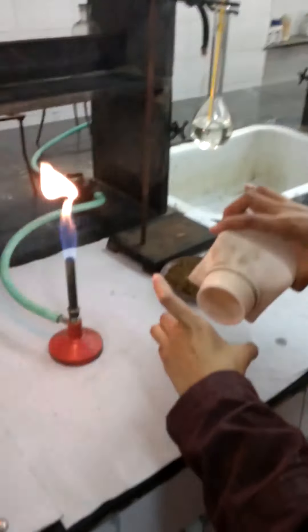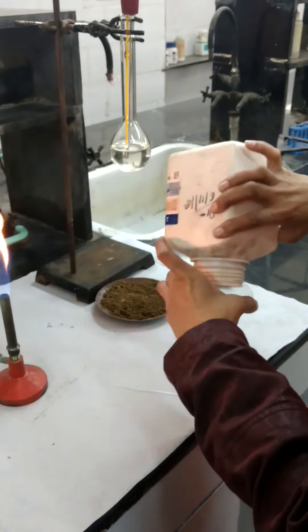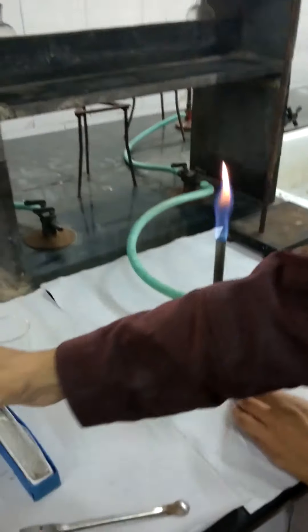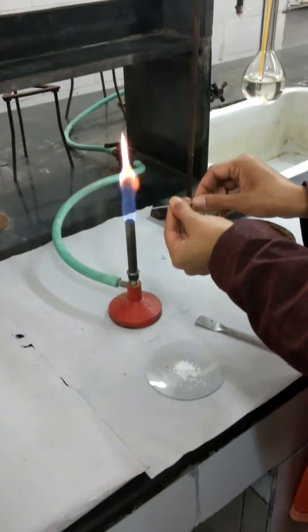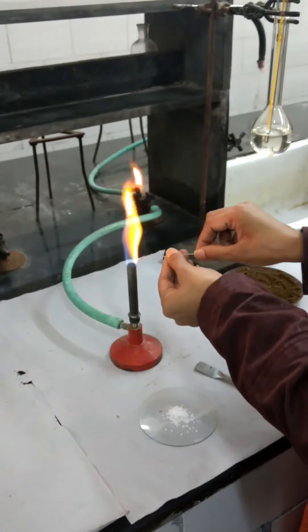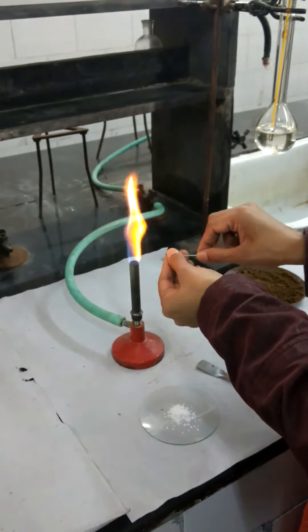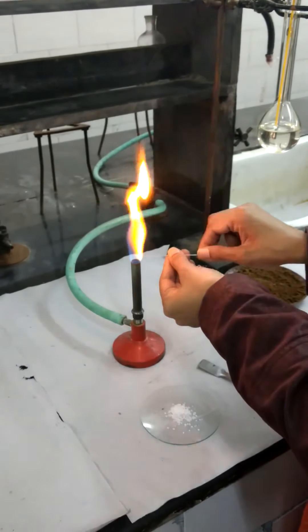For the sake of simplicity, I am taking benzoic acid, solid. Now seal the capillary tube from one end by placing its one end in the outer flame and rotating it continuously, so that it gets sealed at one end, making a bun.